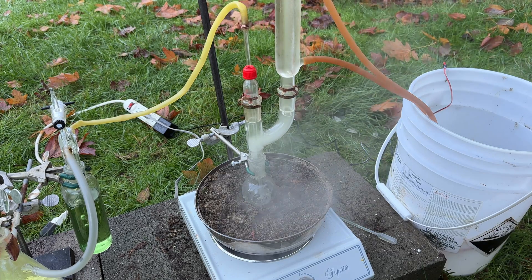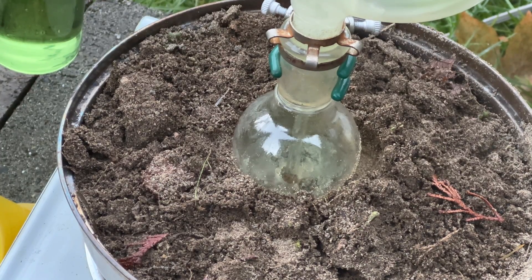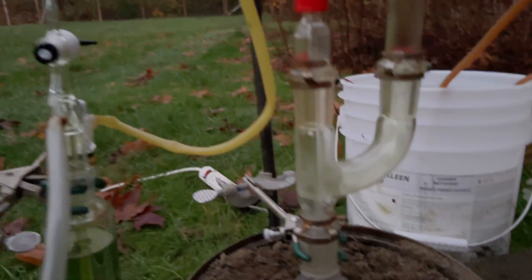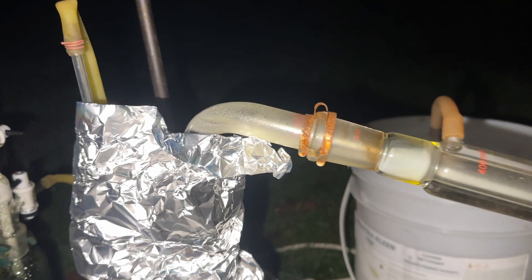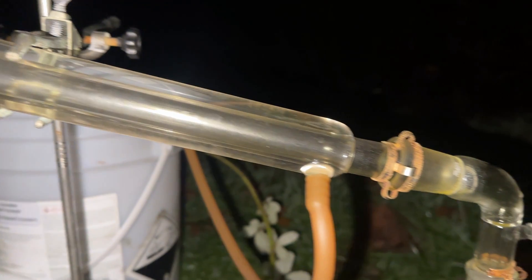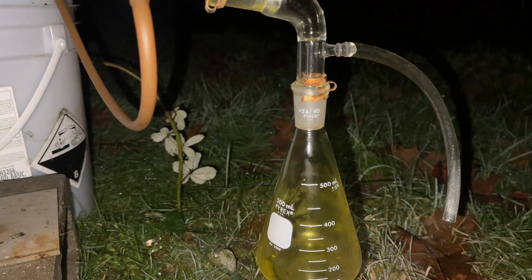Initially, I thought having a tin-chlorine fire was not ideal, so I turned down the hot plate and raised the flask to cool a bit. The tin-4 chloride began accumulating and refluxing in the condenser as it was generated. I soon realized that the chlorine gas flowing through the apparatus carries out some of the refluxing tin-4 chloride vapor, so I decided to cool the apparatus, halt chlorine production, and reassemble the apparatus with the condenser as a simple distillation setup. This should help increase yield by reducing how much tin-4 chloride is carried out with the chlorine.